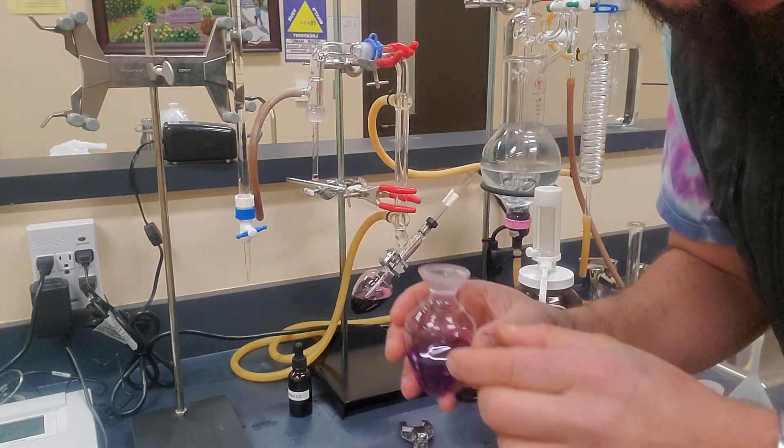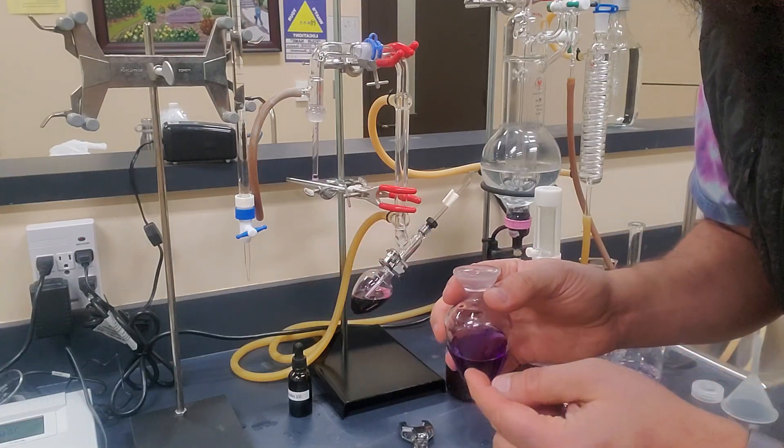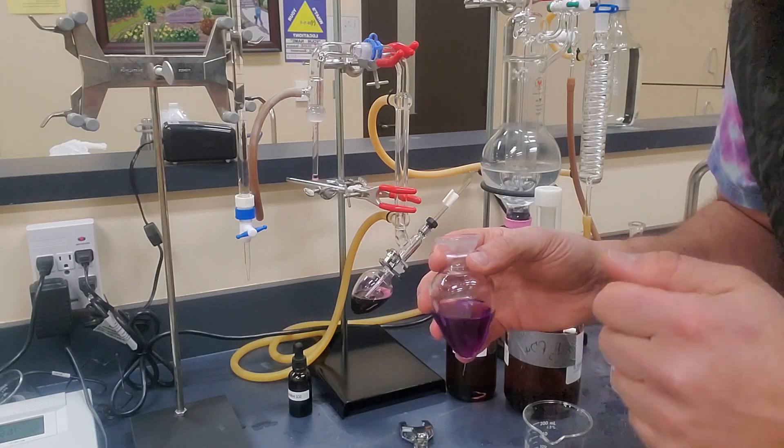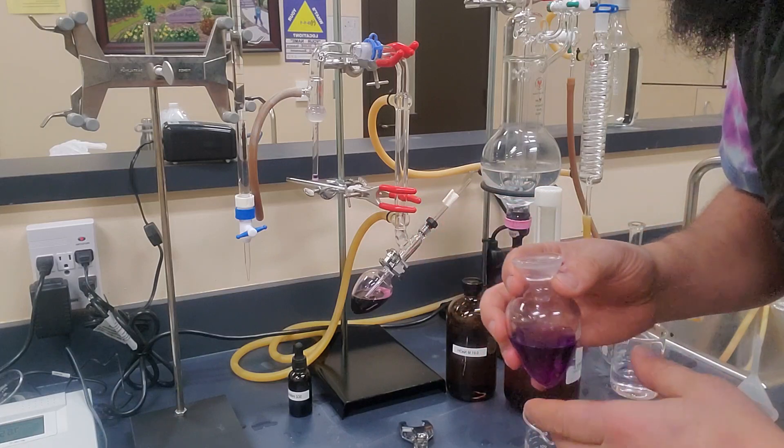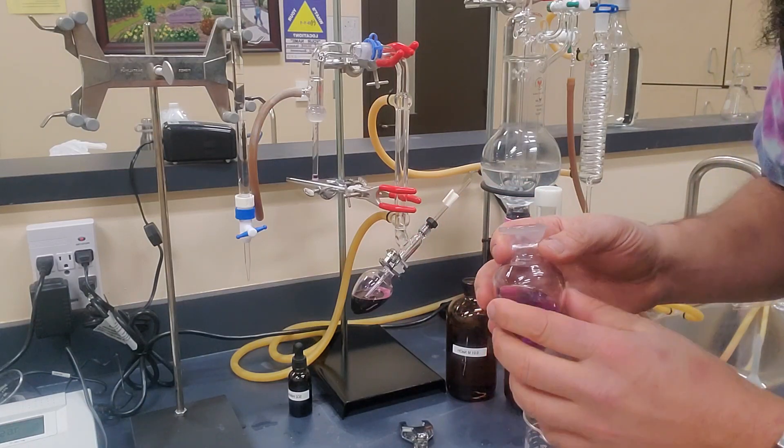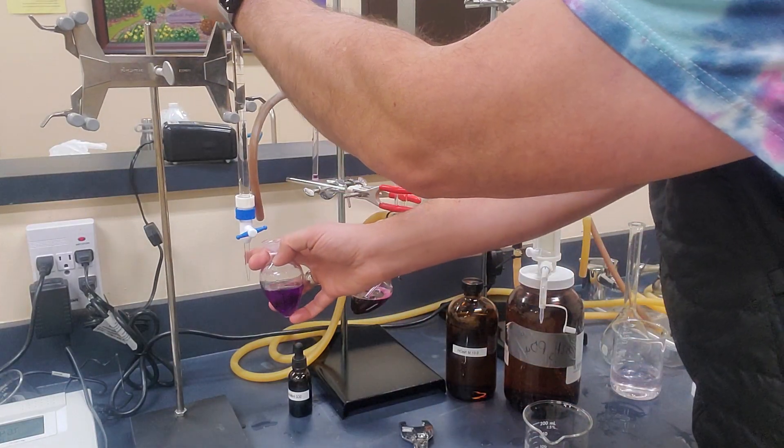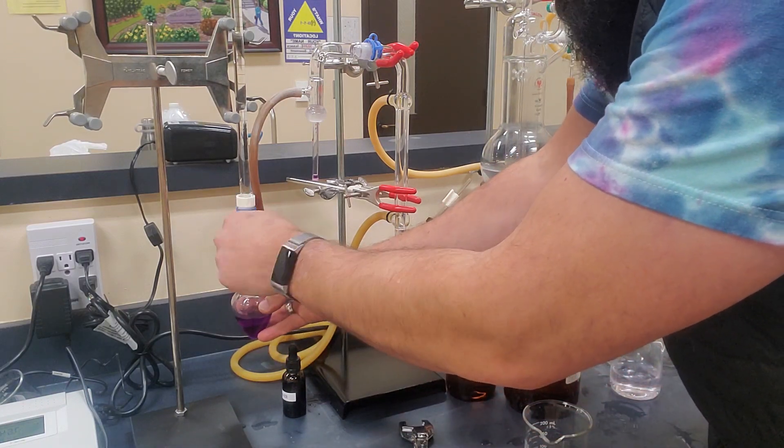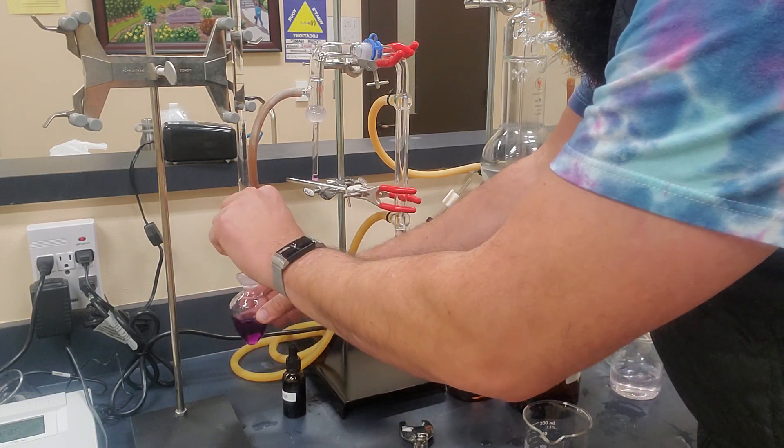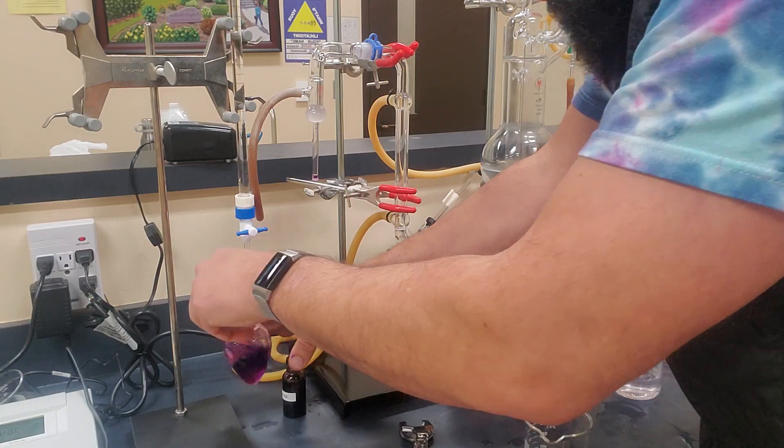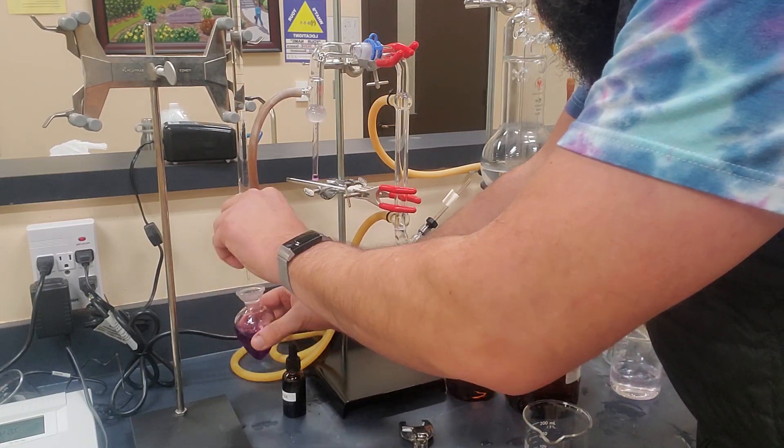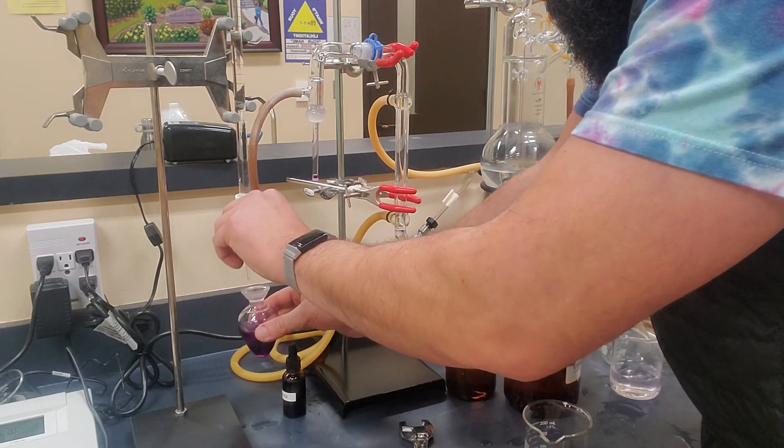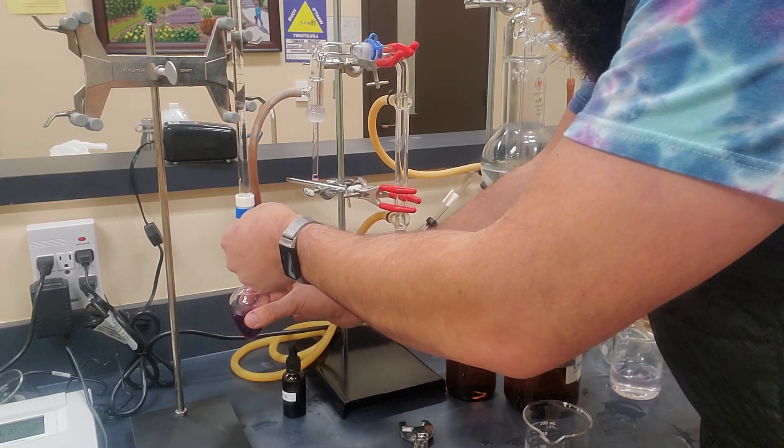And then we'll want to titrate this very carefully. Now when we titrate for sulfur dioxide, the titration value is really small. It's not going to be very big at all. So it's going to be a very quick titration, and you have to be very careful with the accuracy, whereas titratable acidity, you might use somewhere between 7 and 10 mils. When you're doing sulfur dioxide, you might use under a mil sometimes because the multiplication factor is so big. So what we're going to do is we'll take a look at our burette, and our burette is reading right at 8 milliliters. And so we're going to start at 8 is our starting titration, and then we're going to go very carefully and just add a little bit at a time. Do a quick swirl. Every time you just add a little bit, a quick swirl. Add a little bit, a quick swirl. And it's okay to go slow with this because you only get one shot at 10 minutes per run.